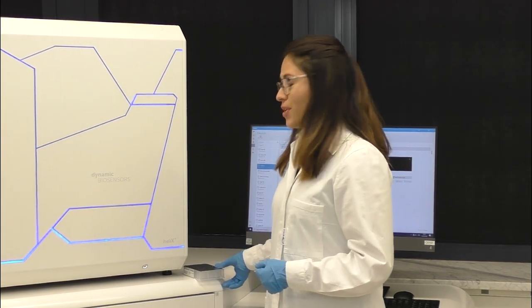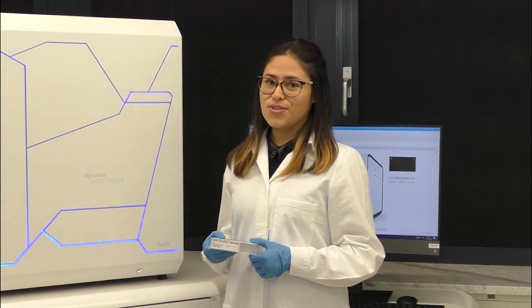Now that our sample preparation is done, we can start our biosensing experiment. By the way, if you are already a Helix user and would like to run this experiment without preparing your own samples, you can try our ready-to-use well plate which are pre-prepared with all the required solutions.